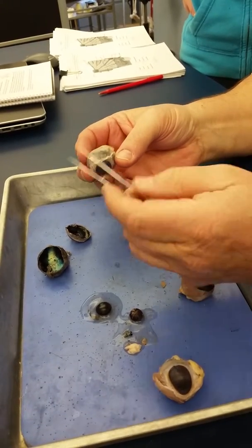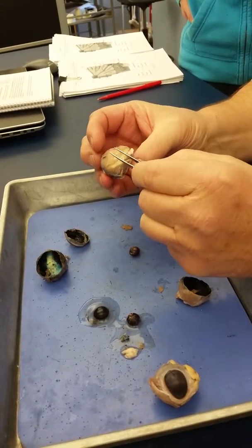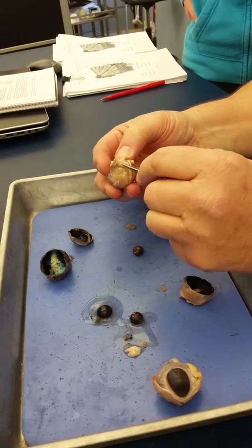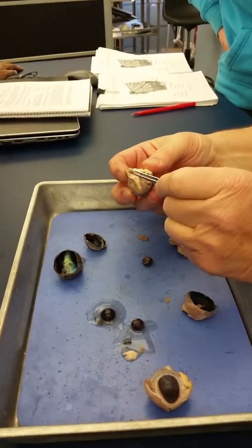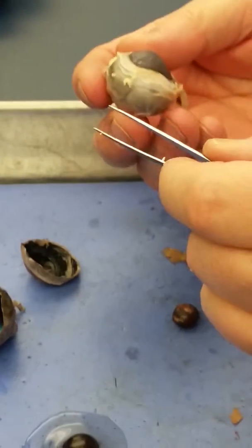If you turn back, we can see that the sclera is where muscles are attached. There's several muscles here, some fat for cushioning, but most importantly, coming out of the back of the eye is the optic nerve. So that takes care of the external anatomy. Any questions?